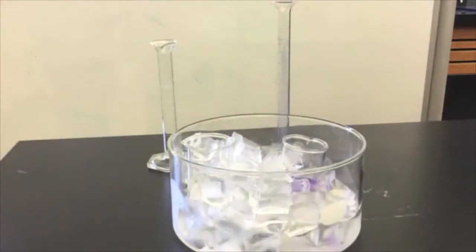You can use a large beaker or share a crystallization dish with another lab partner. After you have set this up, again measure 10 milliliters of each chemical to be used with a room temperature reaction.